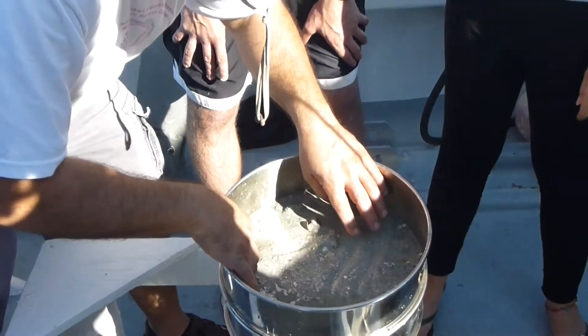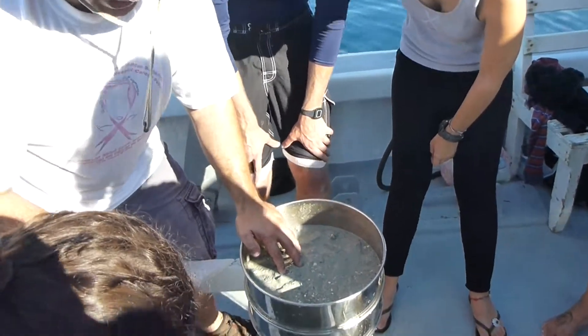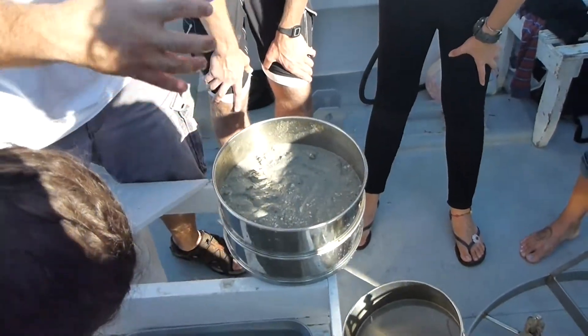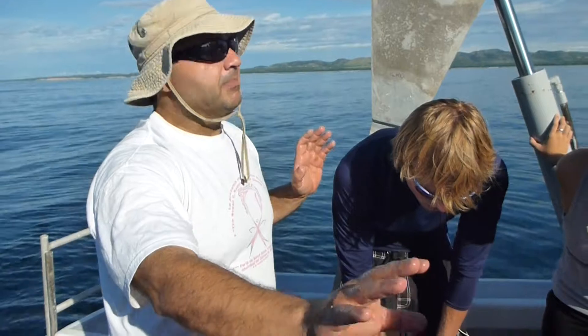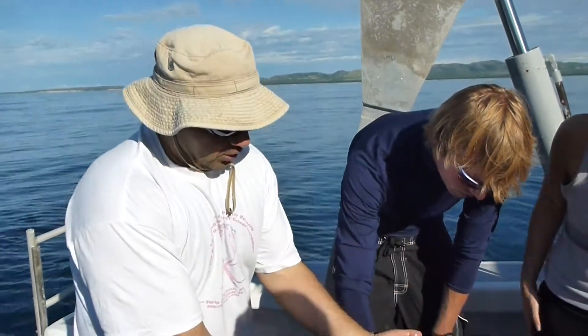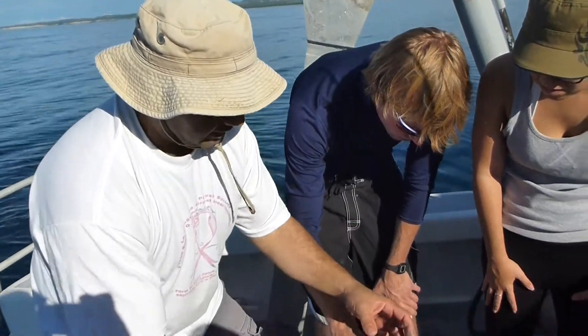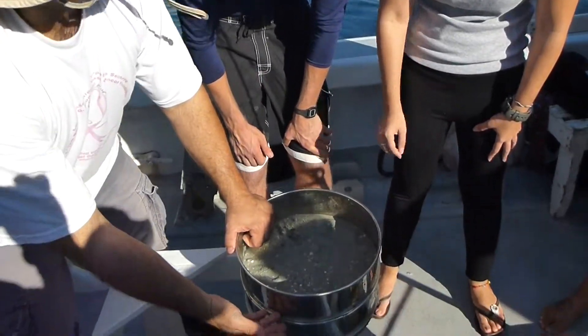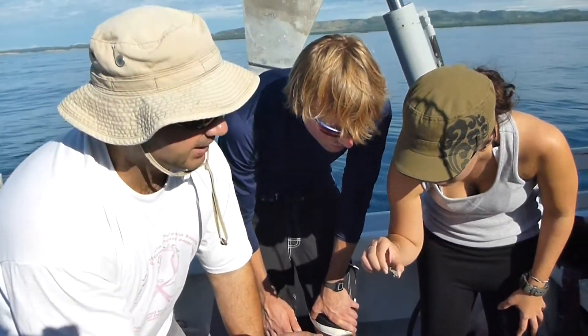Macroinverts. Most likely if the sediment or the sample is rare, you'll have different people looking at different fractions. For example, there may be a macrofauna person taking all the fractions — everything that stays here. So you'll have two or three people working on this. You may have a couple of macrofauna people, or the macroinvertebrate people, or the fish people that may be collecting.